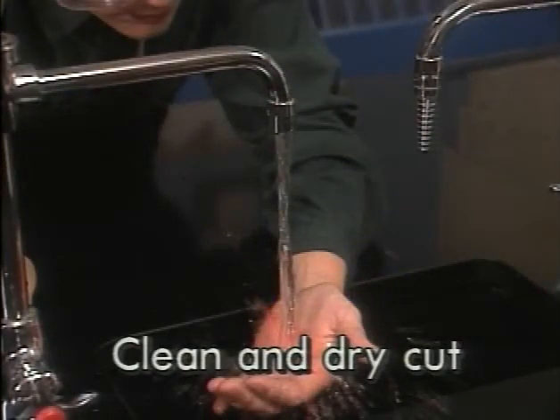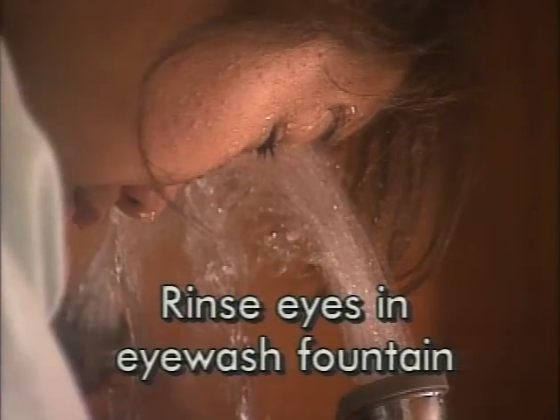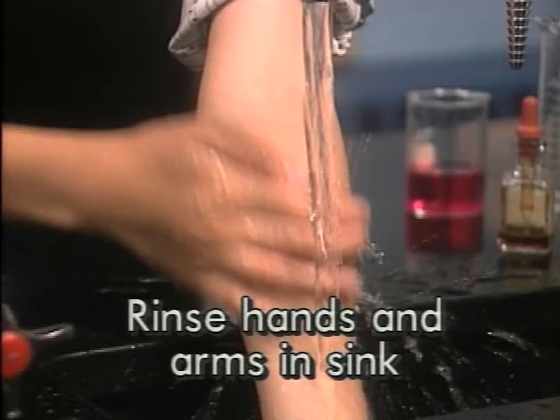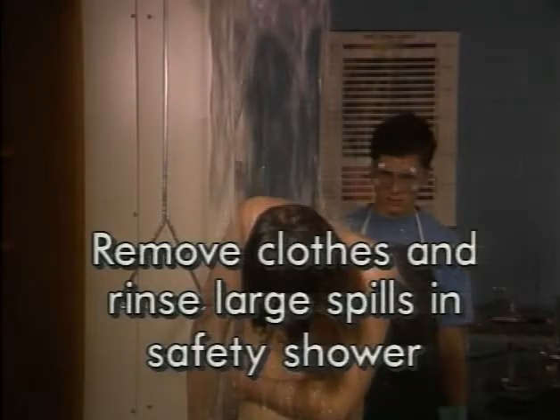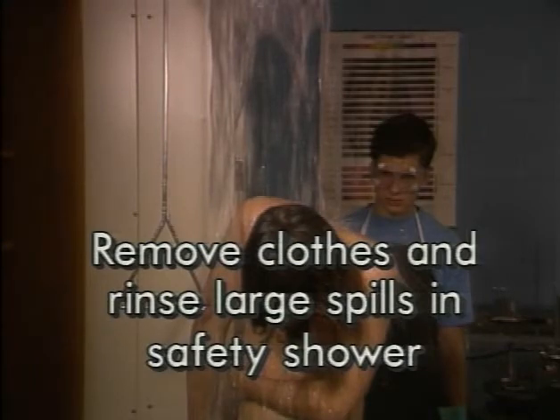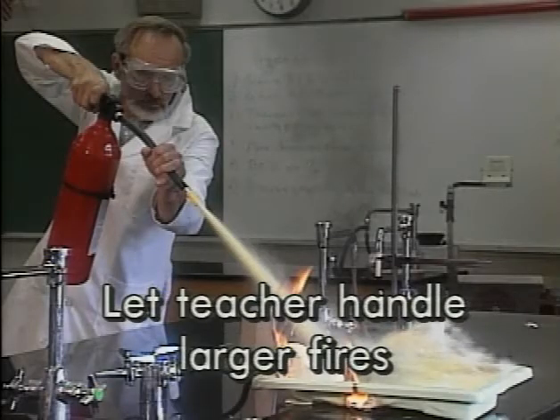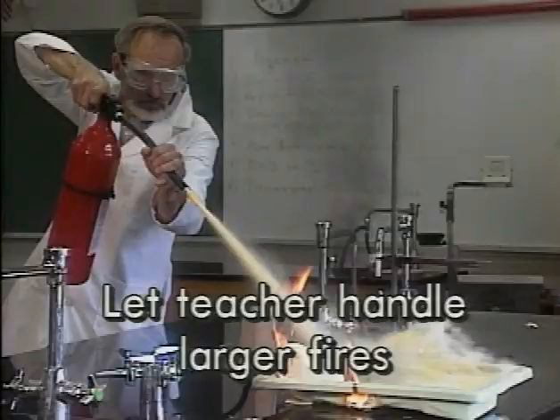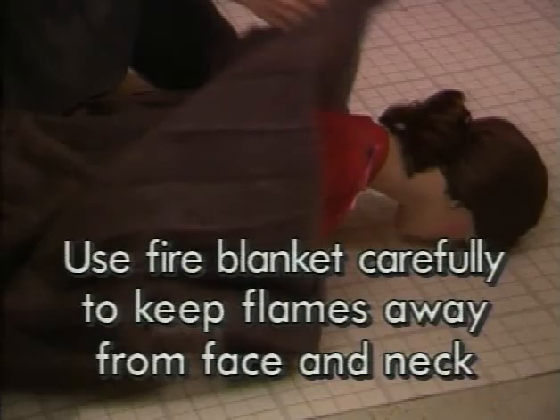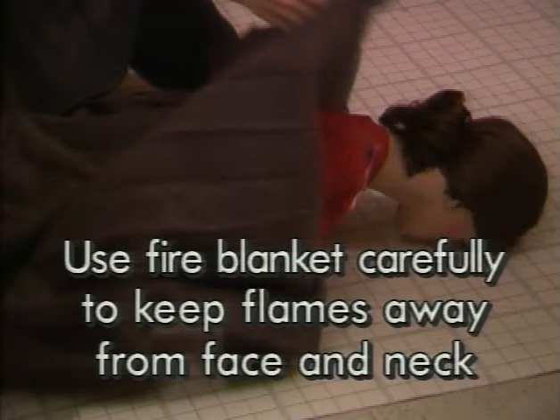Emergency procedures summary: clean and dry the skin around a cut before applying a bandage; rinse chemicals from your eyes in the eye wash fountain; rinse chemicals from your hands and arms with water in the sink; remove your clothes on the way to the safety shower to rinse large spills from your body; extinguish small fires in containers by covering them; let your teacher use an extinguisher for larger fires; put out clothing fires in the safety shower; if there's no other way, use a fire blanket carefully to keep flames away from the face and neck.